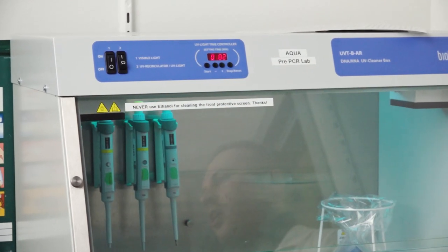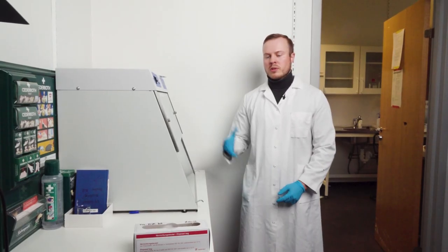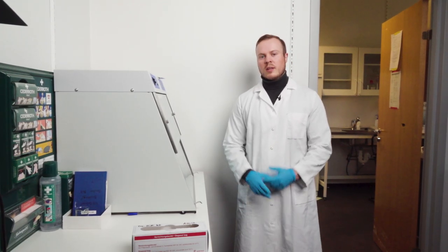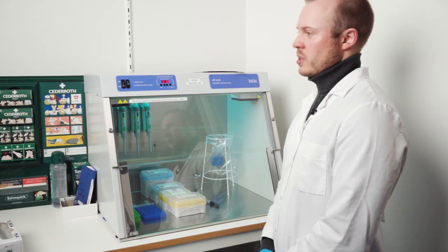Now we need to wait half an hour for the sterilization process to complete and then we can start the actual PCR work.